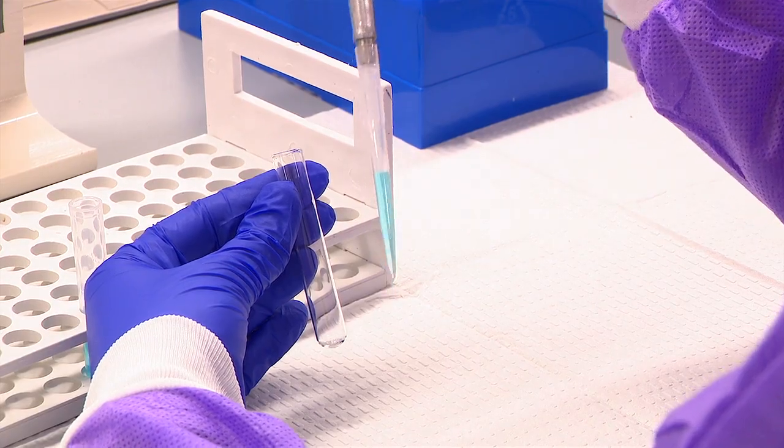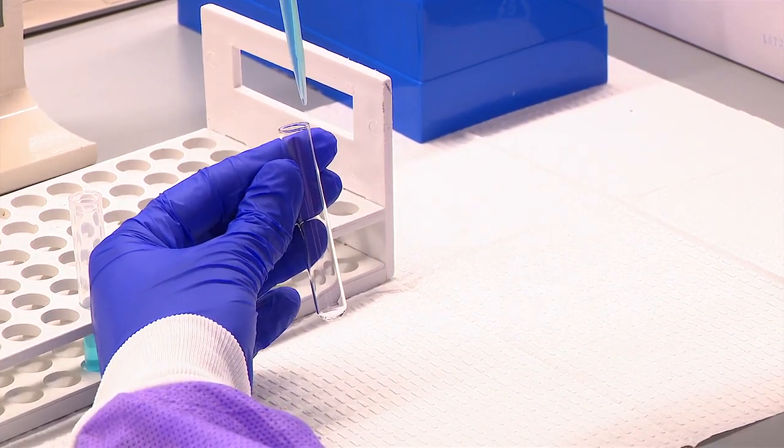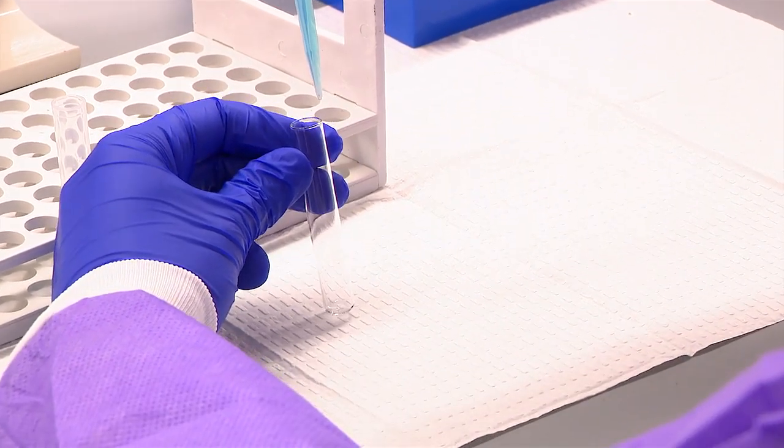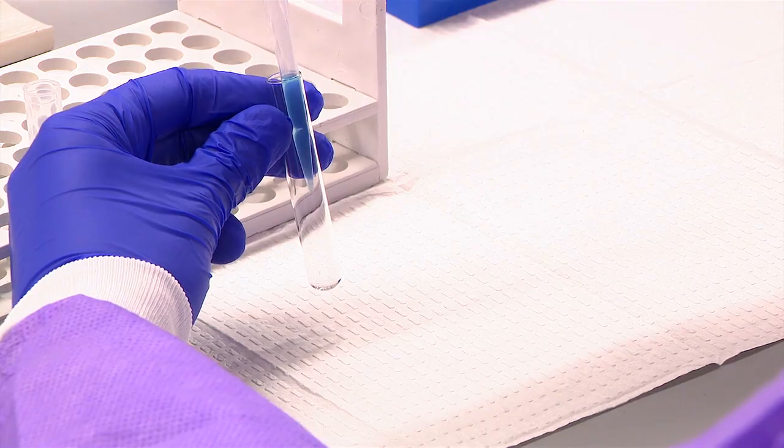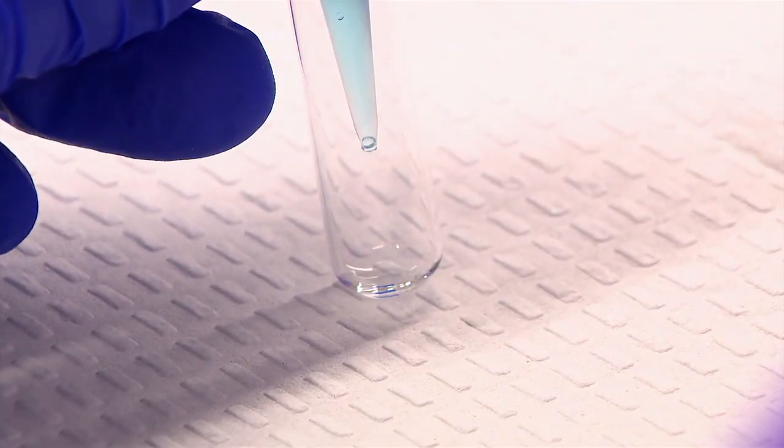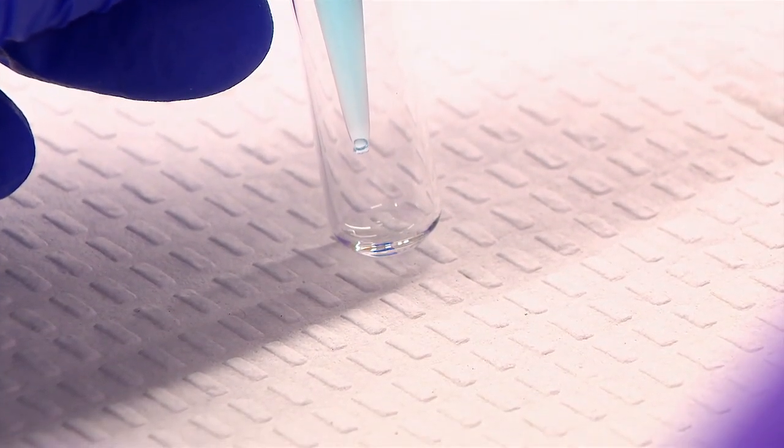Place the tip against the side of the receiving vessel as close to the bottom as possible or if the vessel contains liquid as close to the liquid as possible but without touching the liquid already in the receiving vessel.